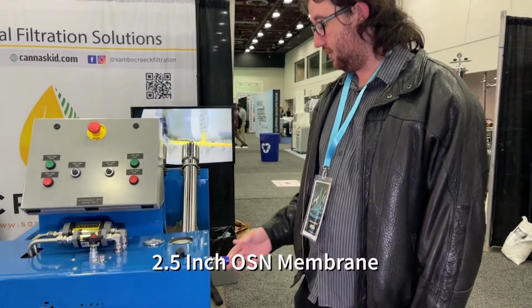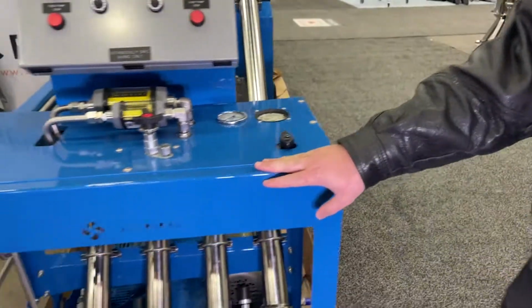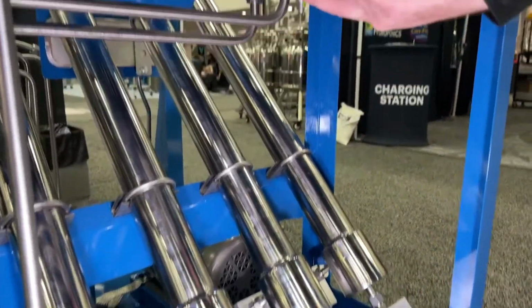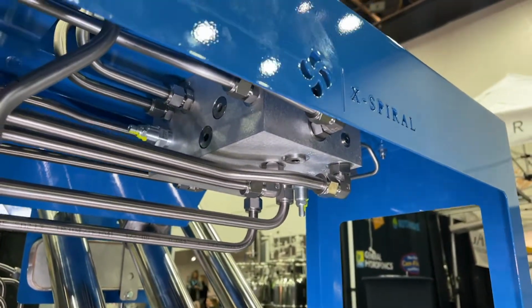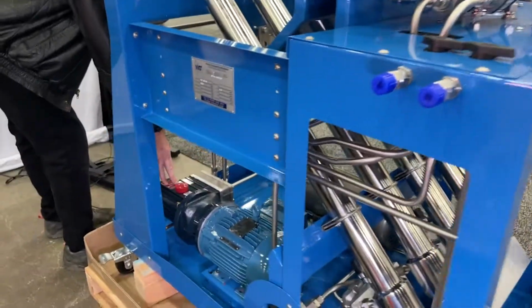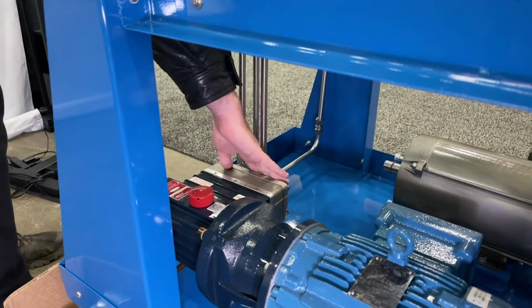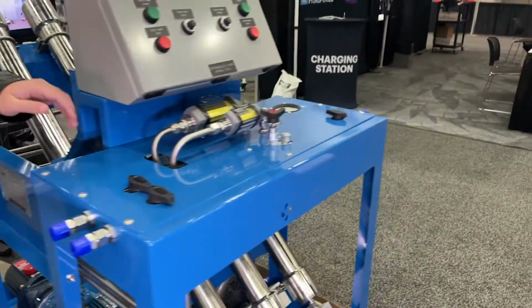The flow pathway goes as follows. Fluid enters the inlet port, goes to the fluid control manifold on the underside of the machine. From there, it is passed over to the feed pump inlet, where it's pressurized to the desired pressure, and then passed by the outlet back to the high pressure portion of the fluid manifold.